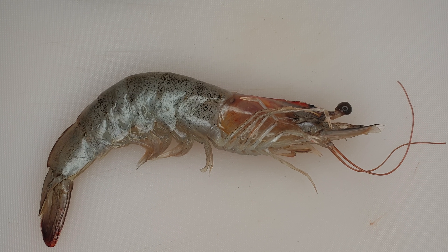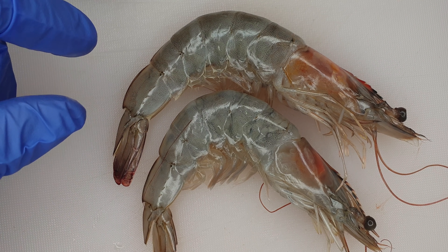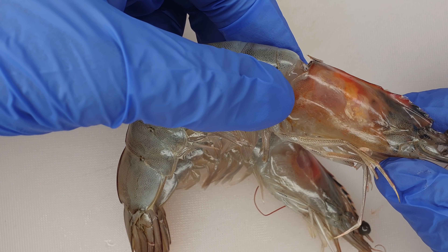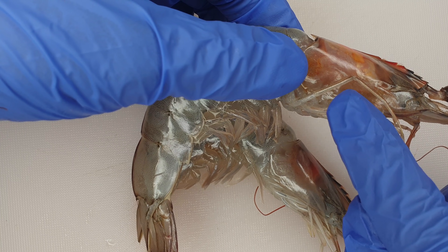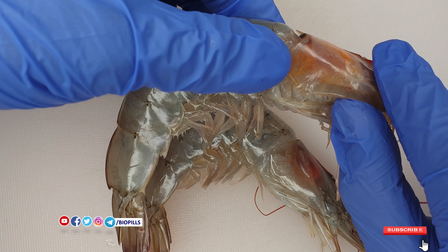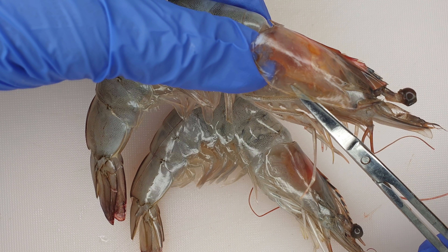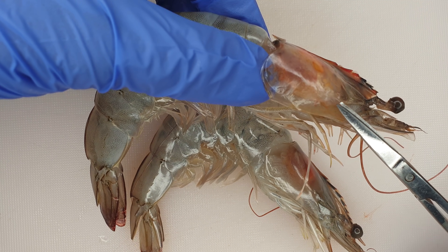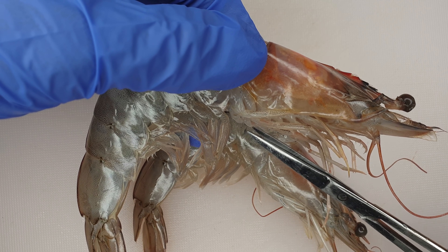Shrimps lie under the phylum Arthropoda. 'Arthro' means joint, 'pode' means leg, so Arthropoda means jointed legs. Looking at the shrimp, it has two distinctive regions. Firstly, we have the cephalothorax — 'cephalo' refers to the brain, 'thorax' is the region after the head — so there is a fusion of the head and thorax forming the cephalothorax, covered by a translucent carapace. The cephalothorax region is made up of 13 segments.